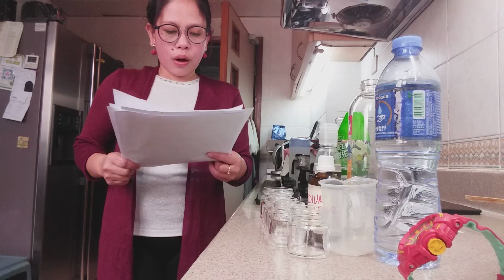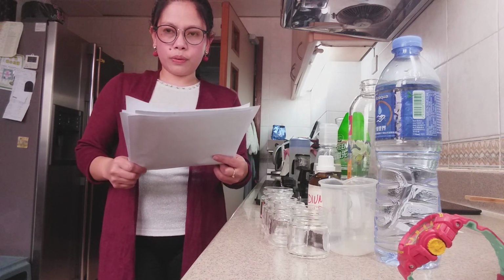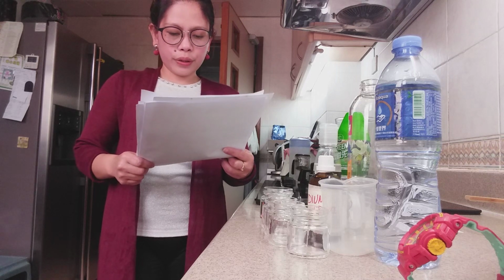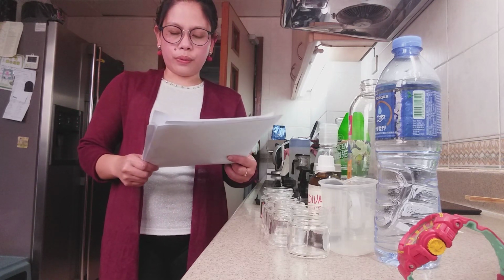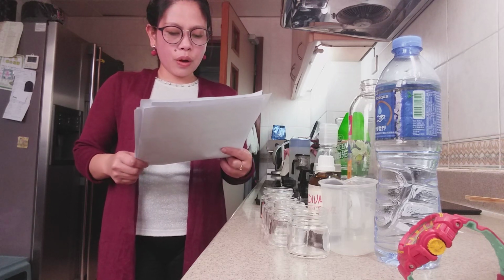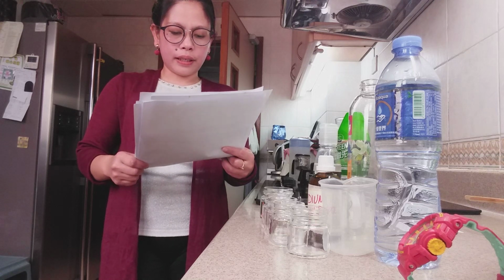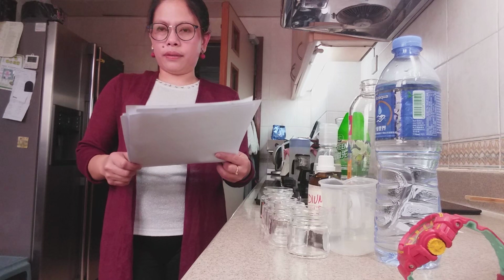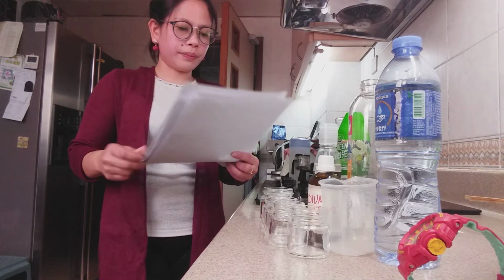Second, always ensure that you wear proper fitting clothes and nothing that is too loose. You should also wear your lab coat to avoid spilling anything on your clothes. And third, one must also know how to use the lab equipment properly and should ask the right way to use it in case they do not know.